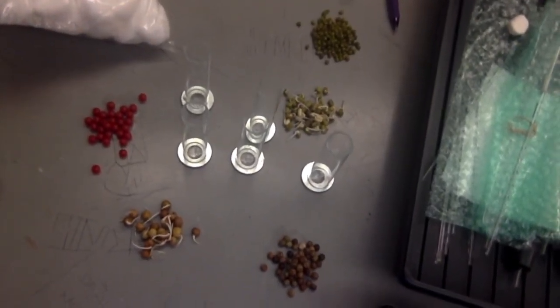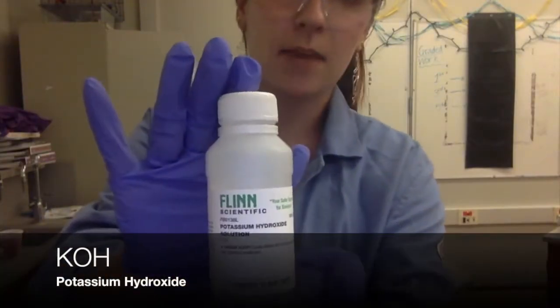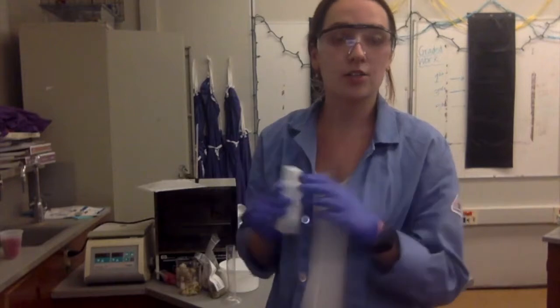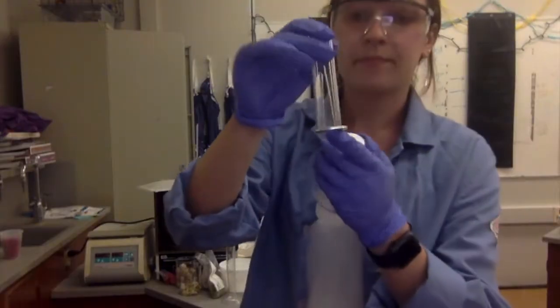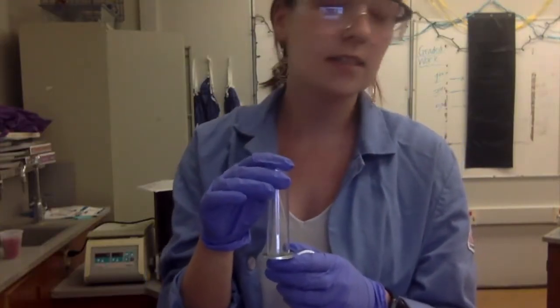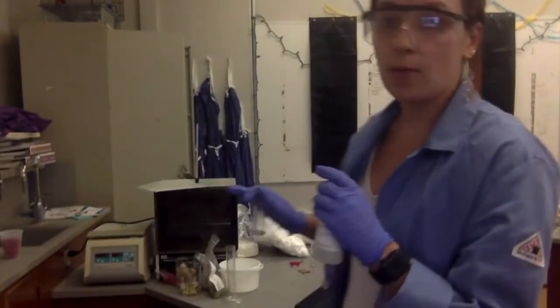Now we're going to set up the respirometers. I've put on some gloves to protect myself from the chemicals used in this lab. I will be using potassium hydroxide, so it's important to wear gloves to protect my skin. I'm going to add potassium hydroxide onto absorbent cotton and place that in the bottom of my respirometer, then cover it with non-absorbent cotton, and then place my different specimens — the beads, germinating peas, non-germinating peas, or mung beans. Then I'll set up the respirometer in the water bath and measure the rate of cellular respiration.